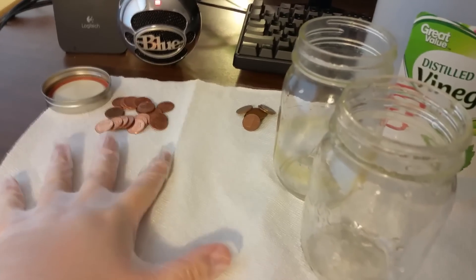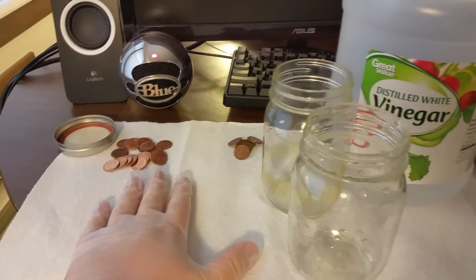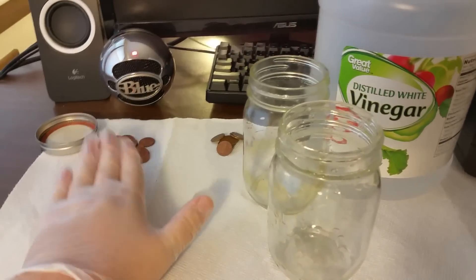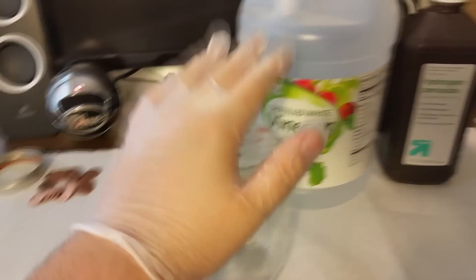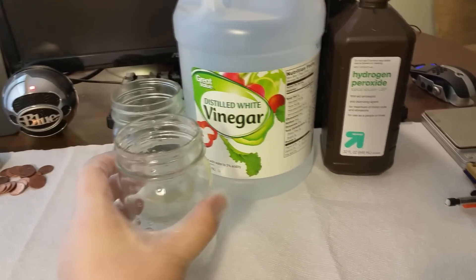To do this experiment we will need two glass containers, distilled white vinegar, and 3% hydrogen peroxide. In addition, I recommend getting a notepad and a laboratory grade scale, typically one that weighs up to 500 grams — you can get them on eBay for about $5.